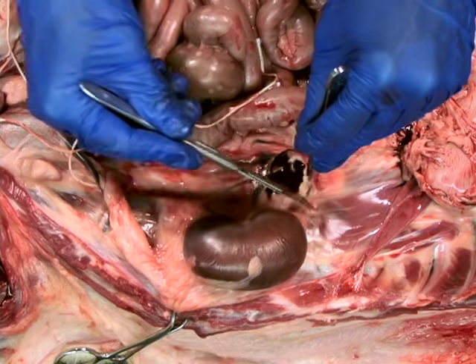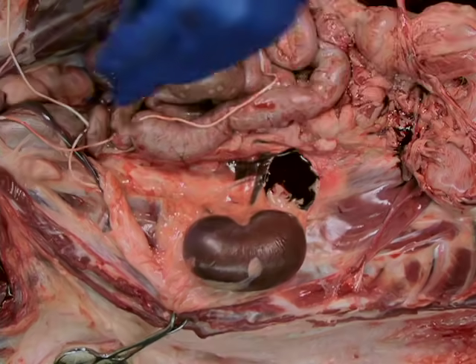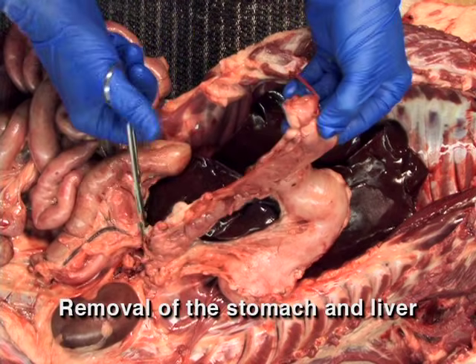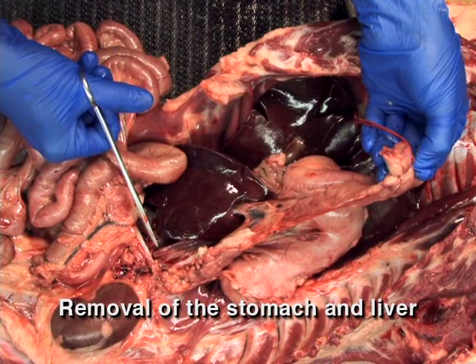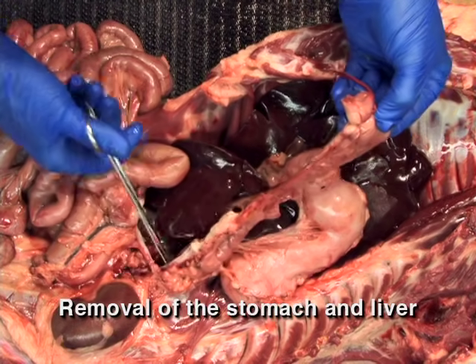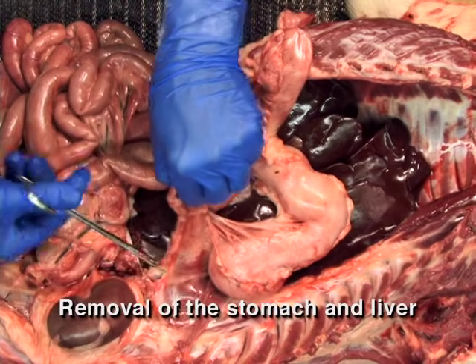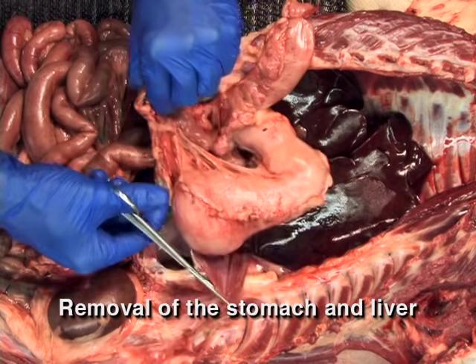are removed in toto. With this approach, optional ligatures of the GI tract are usually not needed because the cardiac sphincter of the stomach is strong enough to prevent spillage of stomach contents, and rectal contents are squeezed away from the point of incision to avoid fecal spillage. In this video, however, we present an alternative approach for the removal of the gastrointestinal tract, which preserves the attachments between the stomach and liver.